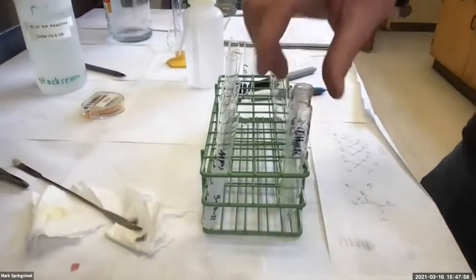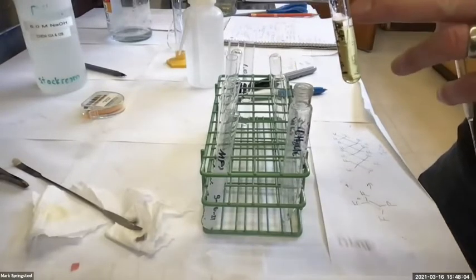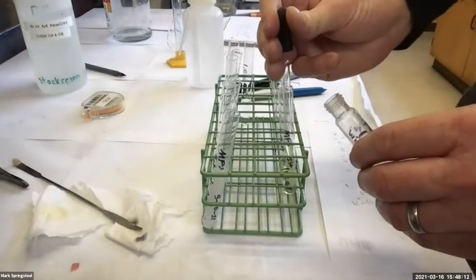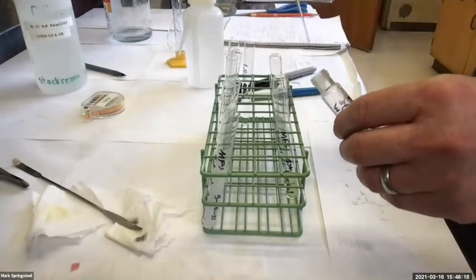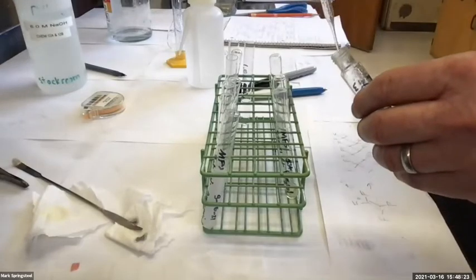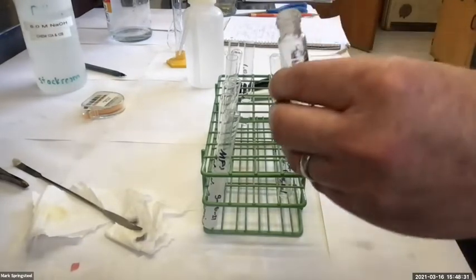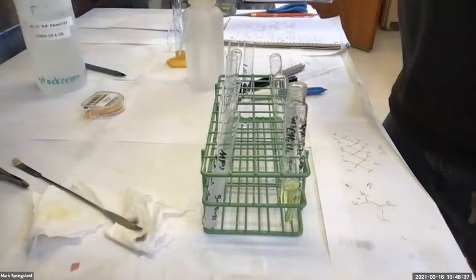My original centrifuge tube's empty, and I pulled out my organic layer to the side to test it with water, but I could put this back in. And that little bit of water in there, that's okay. It'll just dilute the 1 molar HCl that we add. Maybe it'll make it like 0.85 molar or something, but that's fine, that's plenty. Or maybe I'll decide to add a tad more than 4 milliliters. All right, I got that back in there. And then I'm adding the 1 molar HCl.